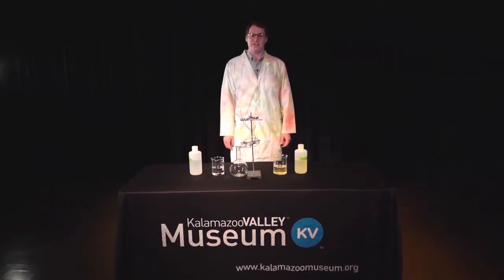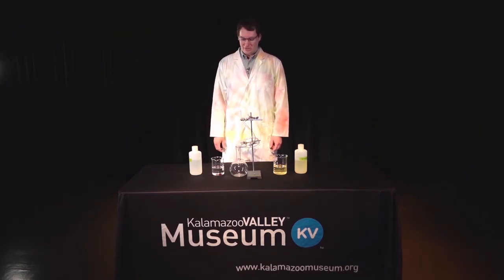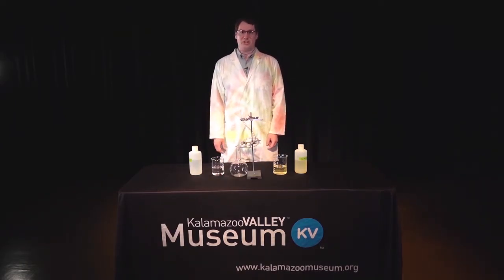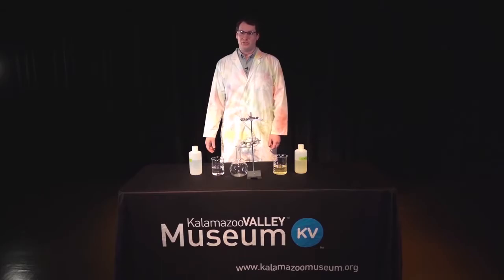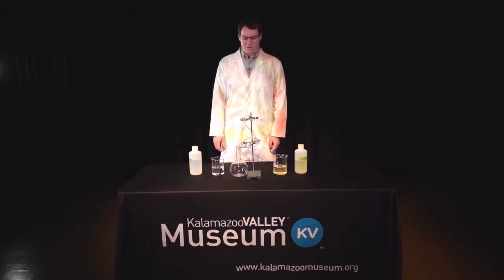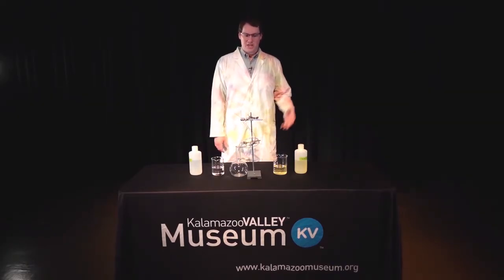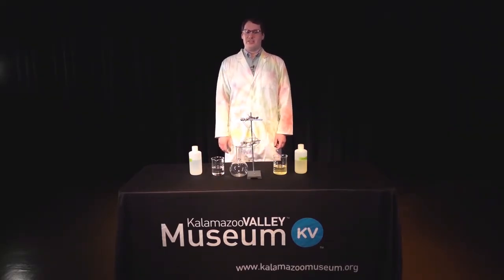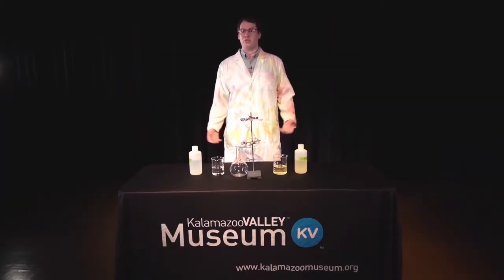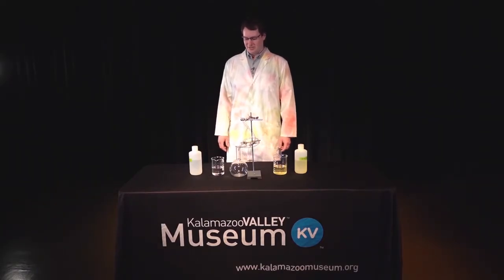Chemiluminescence is a chemical reaction that converts chemical energy into light. The chemical energy that we're going to use is hydrogen peroxide. That hydrogen peroxide is going to react with a molecule called luminol and introduce chemical energy into the luminol. The luminol will then take that energy and convert it into light. This is the same idea as a glow stick, and so this is a way that we can create light without any electricity and without any heat.